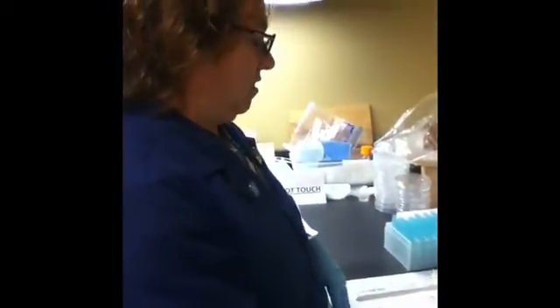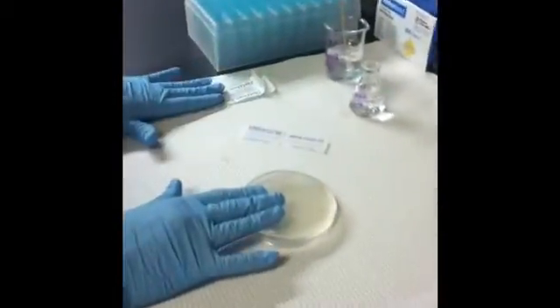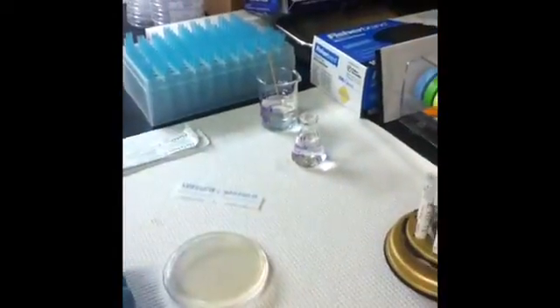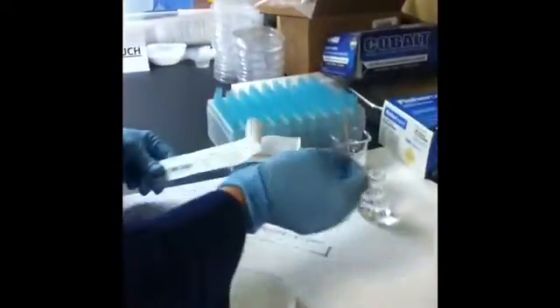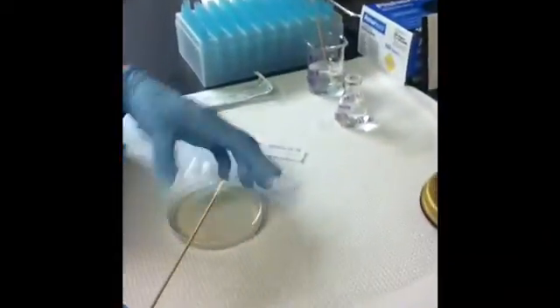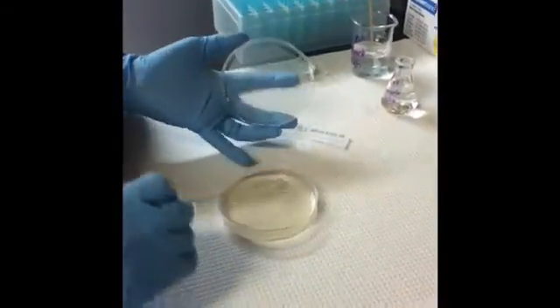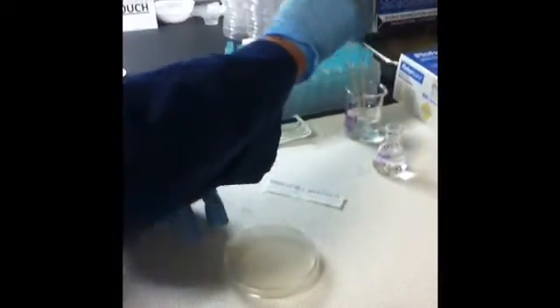This week we're going to be assessing antibiotic resistance in Staphylococcus. The things we'll need are an agar plate, parafilm, sterile swabs, sterile saline, and a bleach solution. First, take the sterile swab, dip it into the sterile saline, and rub it on your arm or wherever you choose to take your sample. Then take your agar plate and rub your sample on it — this is called streaking. Put your used swab in the 10% bleach solution.